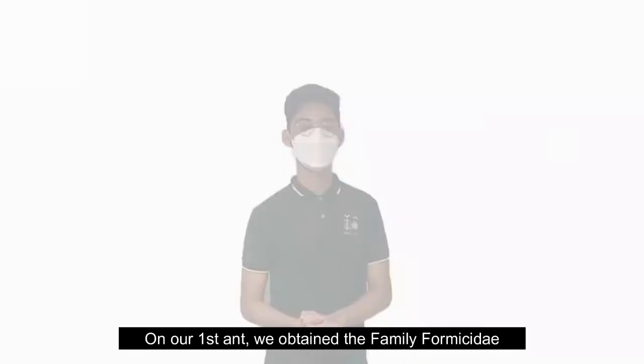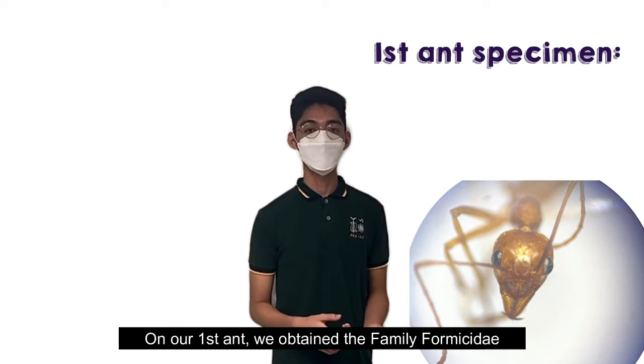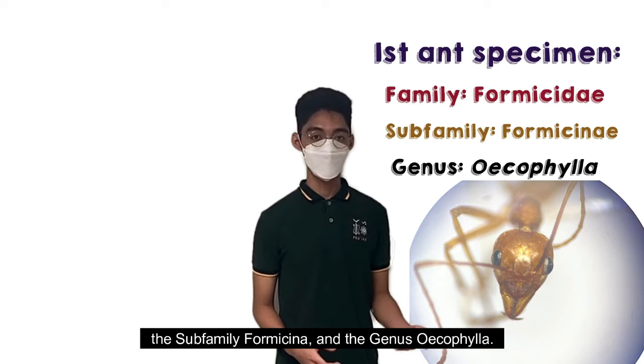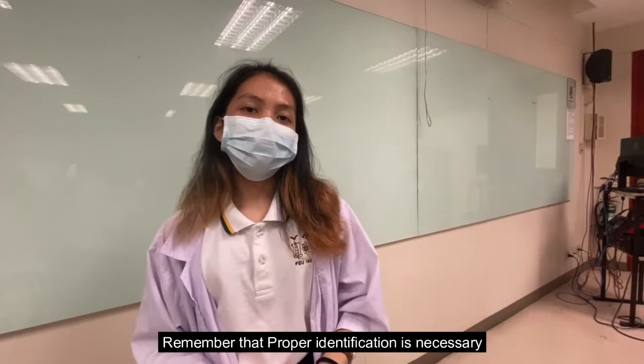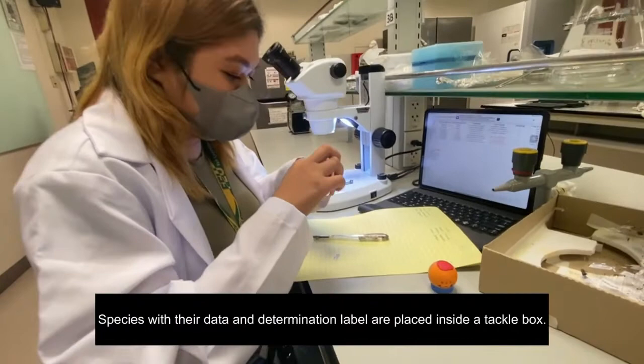For the first ant, we obtained the family Formicidae, the subfamily Formicinae, and the genus Oecophylla. For the second ant, we obtained the family Formicidae, the subfamily Myrmicinae, and the genus Solenopsis. Proper identification is necessary as it tells a lot about the insects — their lifestyle, behavior, and the causative agents or illnesses they may carry. It is important that after identification, species with their data and determination label are placed inside a tackle box, which functions for the storage and display of mounted specimens.